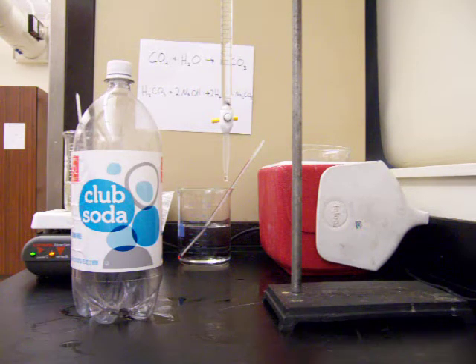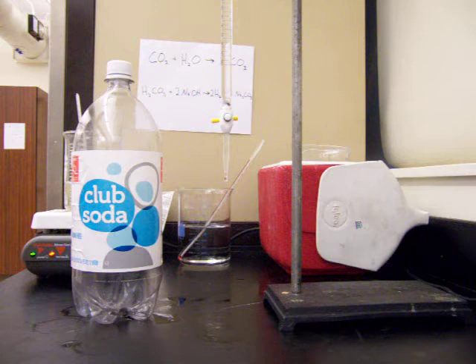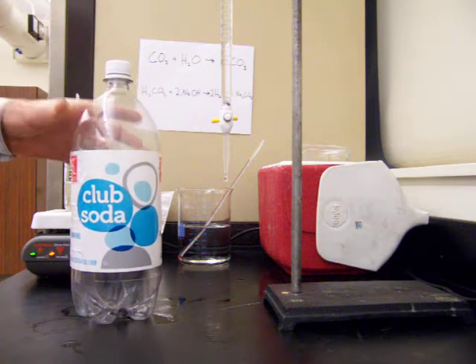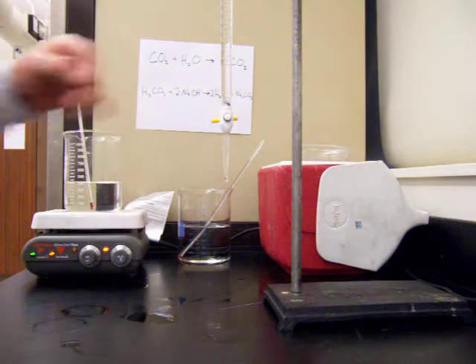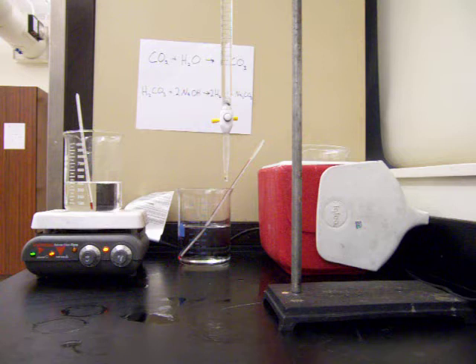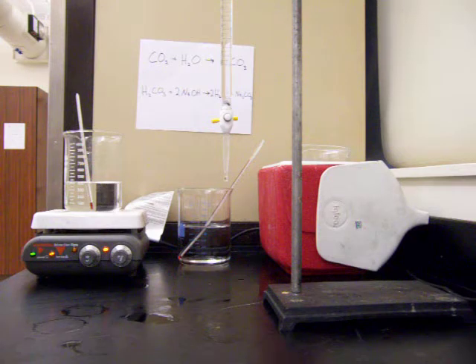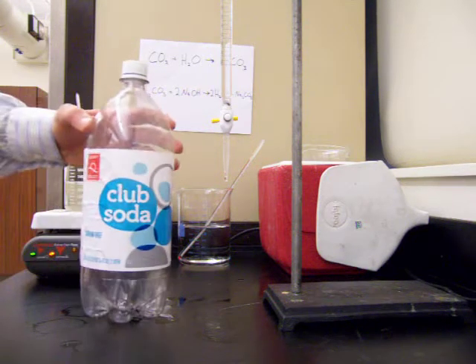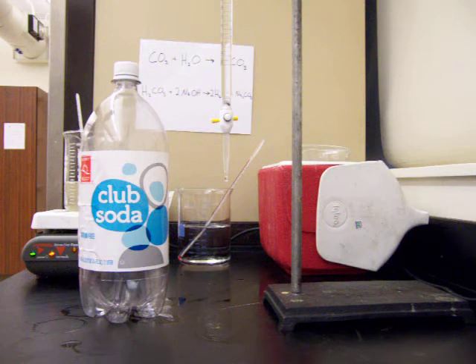That is the solubility of carbon dioxide lab, where we used club soda at three different temperatures and measured the concentration of carbon dioxide in each one. Now you're ready to do the calculations and make a solubility curve.